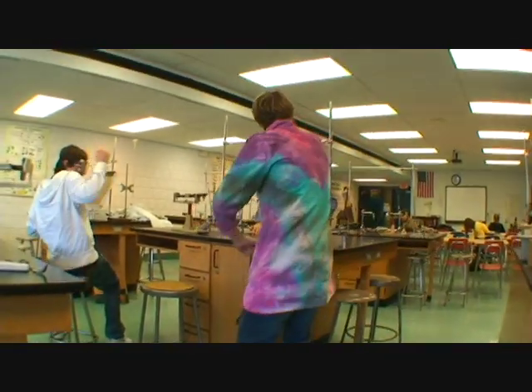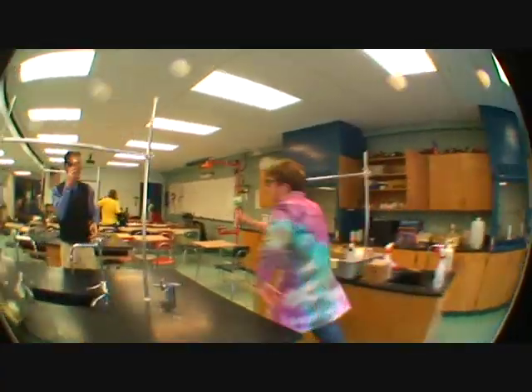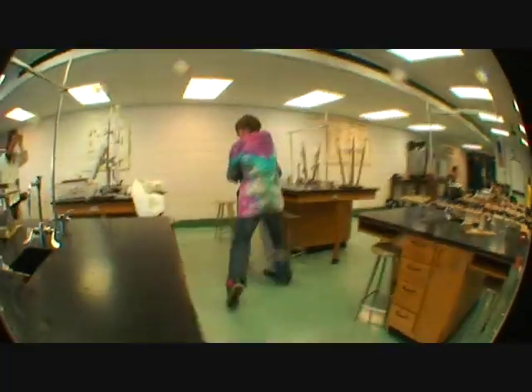Hey. There is no water spraying in my lab. No. That's an office referral for a mister. Come on. You're getting out of here. Good, Jamal!